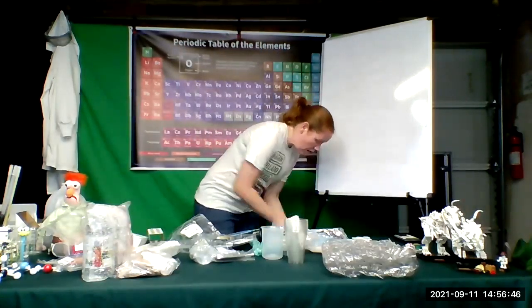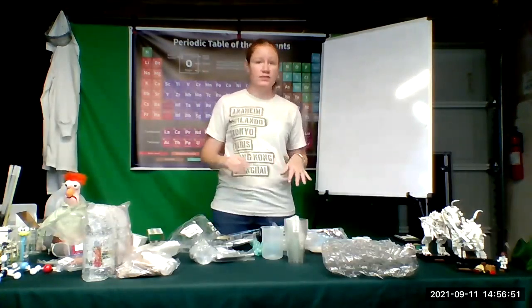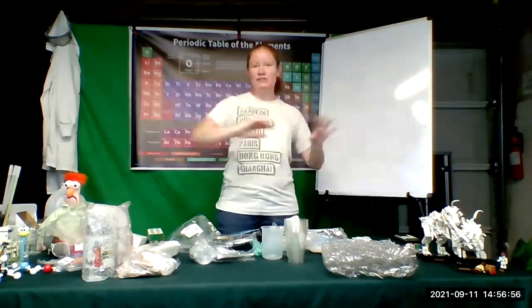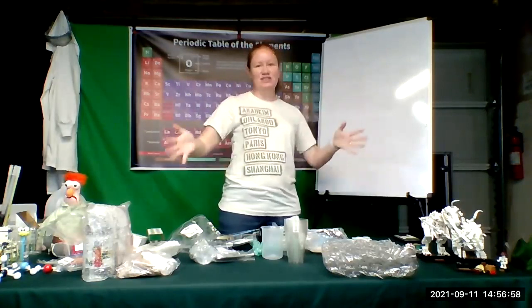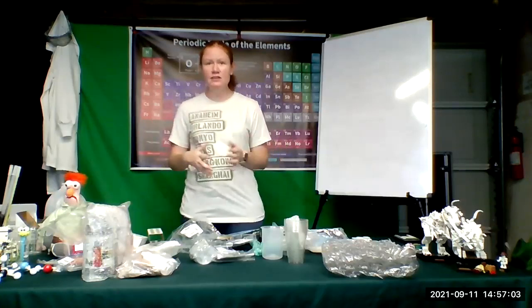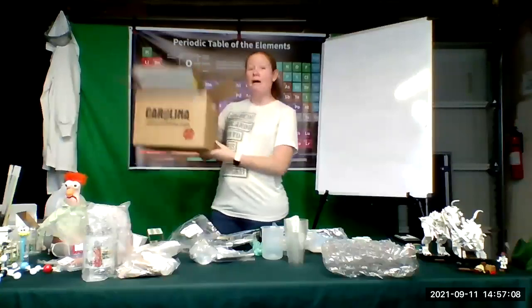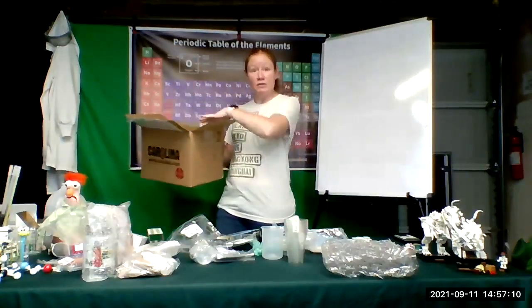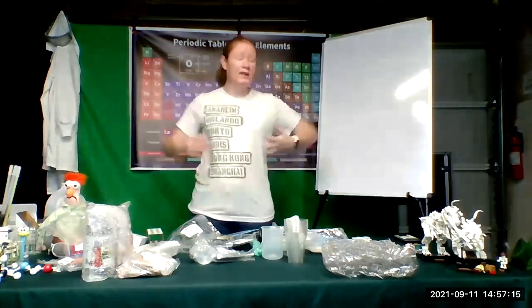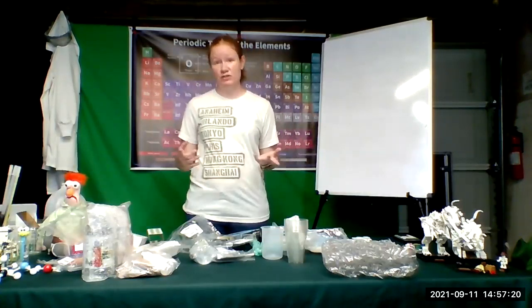Okay. Now, I have all of my stuff in rolling 3-drawer carts in my garage since I teach multiple classes. Depending on what I'm teaching at any given time, I roll a different cart over here so that I can do whatever demos that I need to do. But you're just taking the one class. So you don't have to get anything as fancy as what I've got. You can take the same box that your kit shipped in, and you can store all your materials in this box. And then you just pull the box out as you need it. Or you can get a plastic tub or something else if you choose, but you don't have to get anything fancy to store your stuff in.